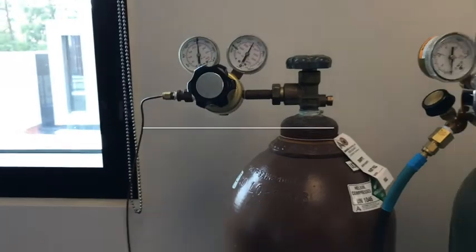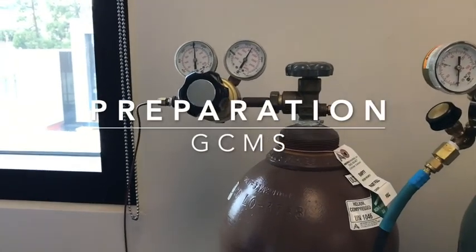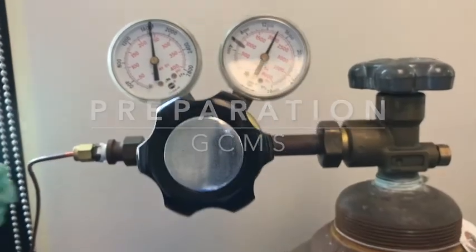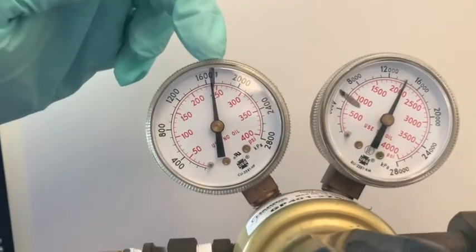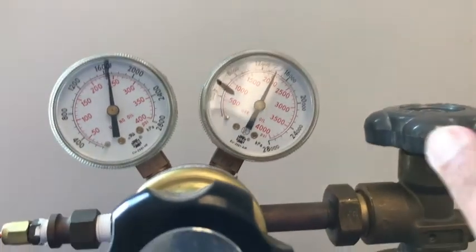Before we start running the GC mass spec, we always have to make sure that the carrier gas, which is helium, has enough pressure. We want to make sure there is enough pressure in the tank going to the instrument.